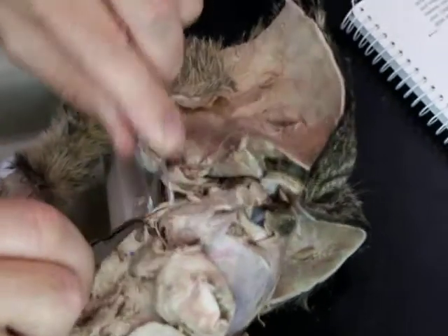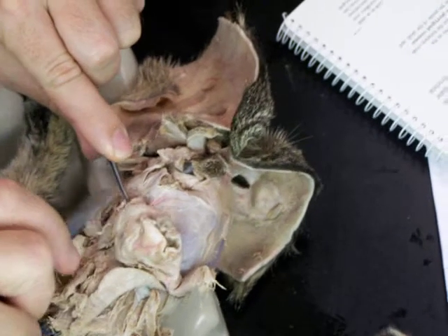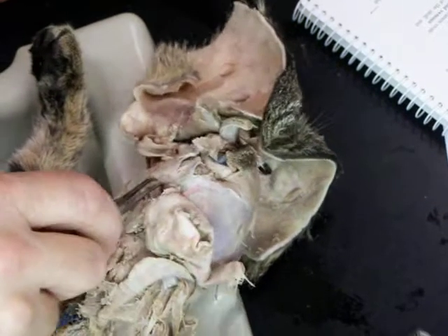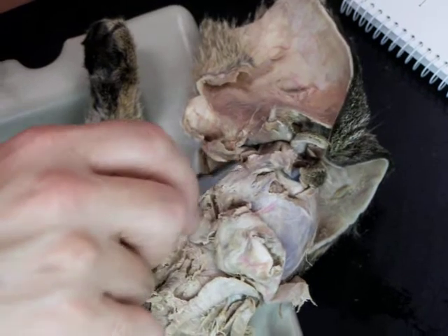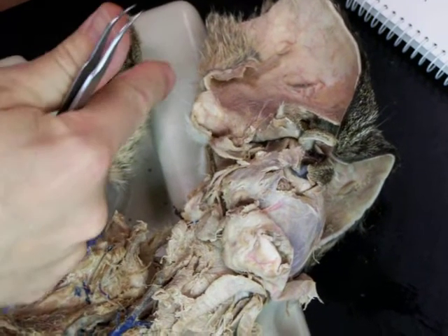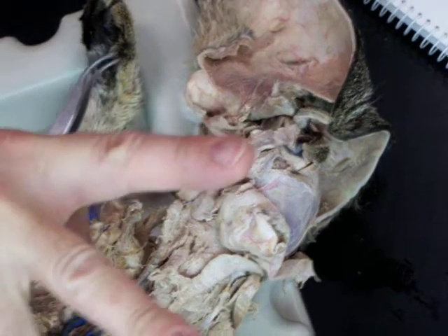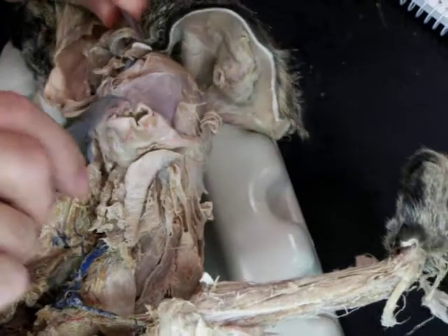And unfortunately, we kind of have to clean this away. This isn't dissected out. You have to dissect deep to the masseter here. And you can go ahead and clean that away, this has all been removed anyways from the surface of the masseter, and see the maxillary and the facial. And then the other two are the two that, one goes in front of the ear and one goes behind it. So the superficial temporal runs up to the temporal region.